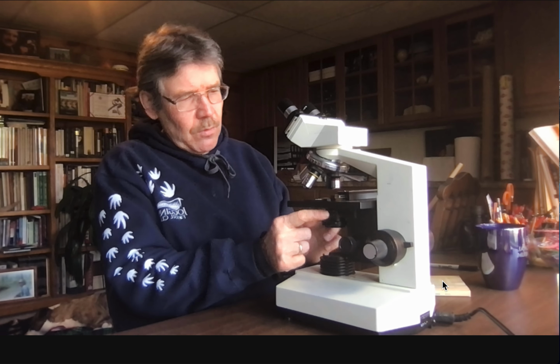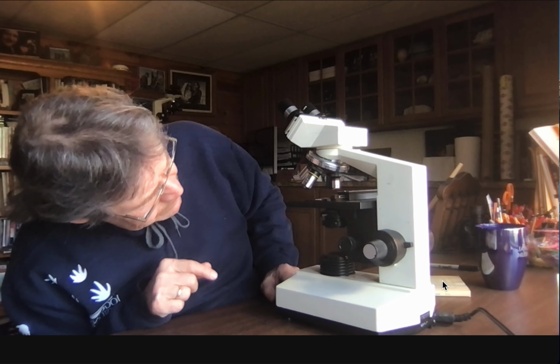Now there's one more adjustment that really matters, and that's part of this condenser lens apparatus. Let's see what I need to do to let you see it. There you go. It's a little bitty lever right here, and that is a diaphragm. Same thing as in a camera in the old days when we had film. It opens up or closes, and it's doing exactly what your pupil does. A diaphragm does what your iris does.